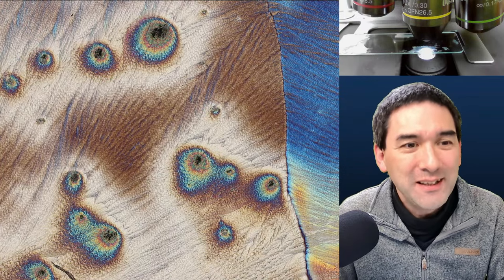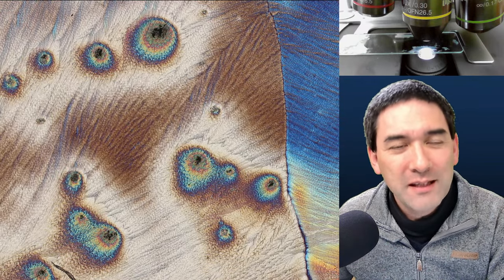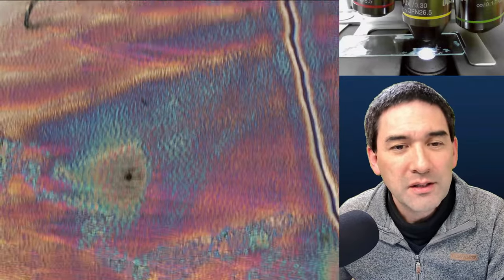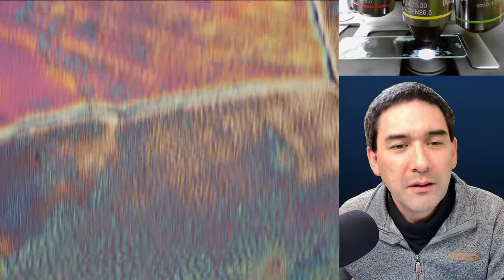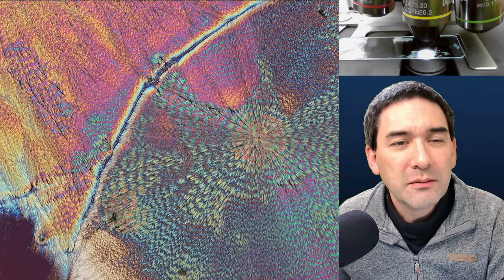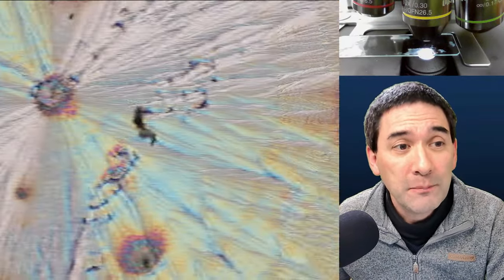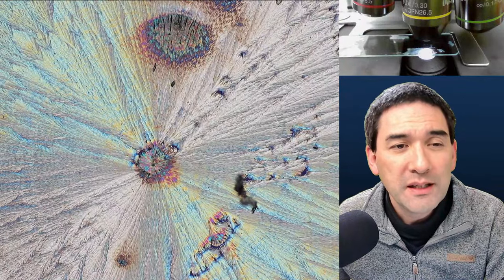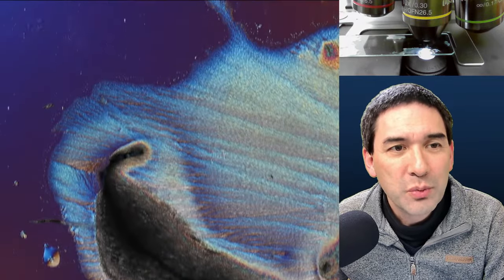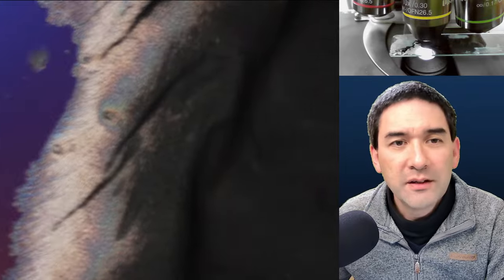Yes, it does look like peacock feathers — that's correct, and that's the reason I wanted to show it. This is something very common in vitamin C under polarized light. The long shapes here are just dust. You need a lot of experimentation because the result depends on the concentration of the vitamin C, how fast it dries, and the type of solvent used. Here I used a mix of water and alcohol, and you can see the central part where crystallization started and spread outward.